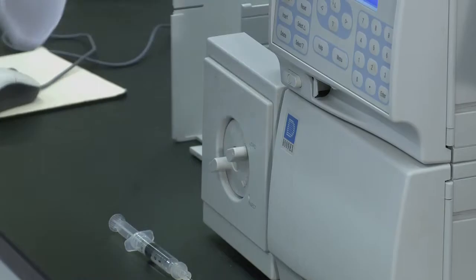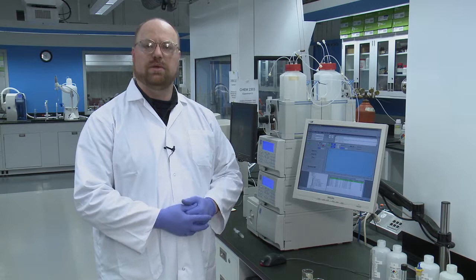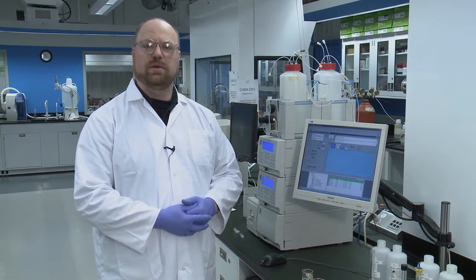And now you're just waiting for the length of the run. Once the run is completed, that manual injection window will pop up again. And you'll be able to see by the highlighting what it is that you need to inject when it's done. Once all your samples have been analyzed, see your TA or the lab coordinator on how to get your data.